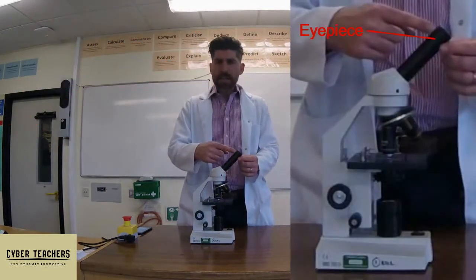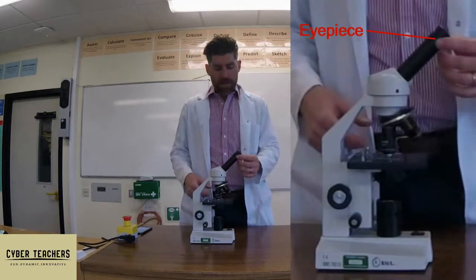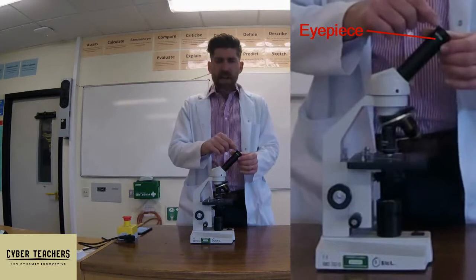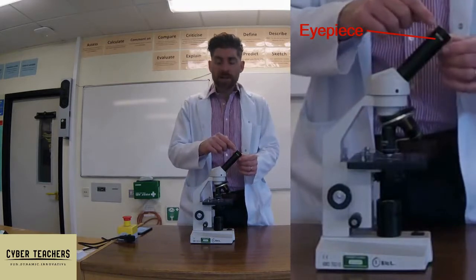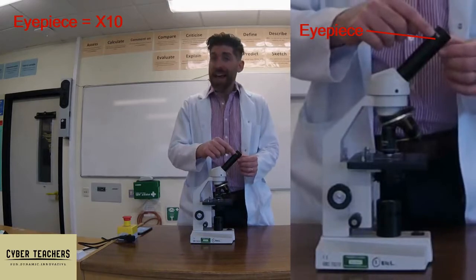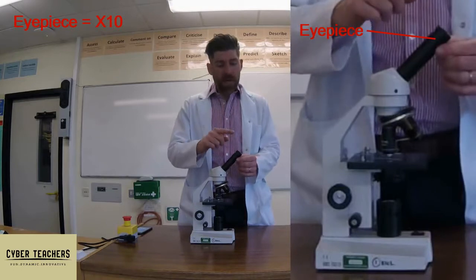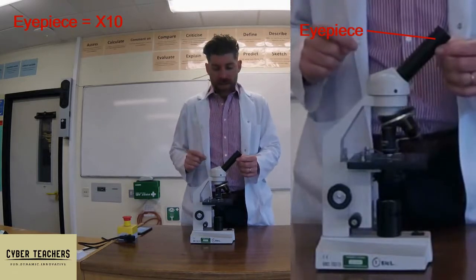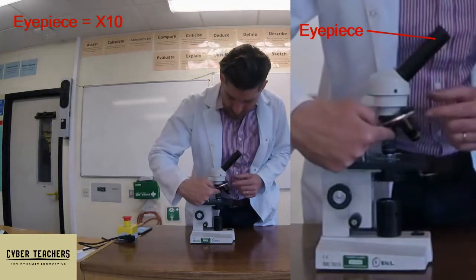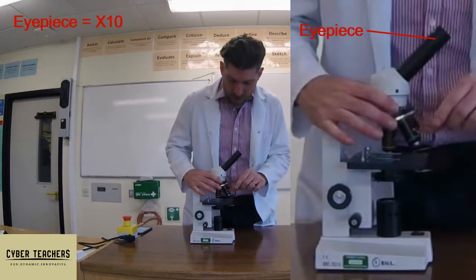Number three: we need to know the parts of the microscope. Here we have the eyepiece — it's the bit that you look down, so you put your eye to it. This has a magnification in it; this alone has a lens that makes things 10 times larger. I know this because it says 10x on it. Your microscope might say something different, so just beware.